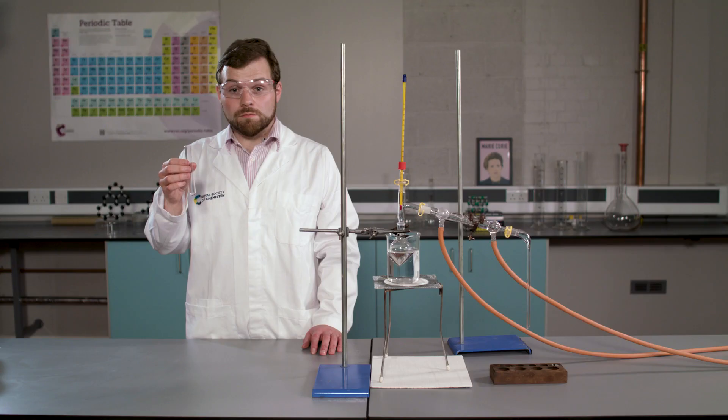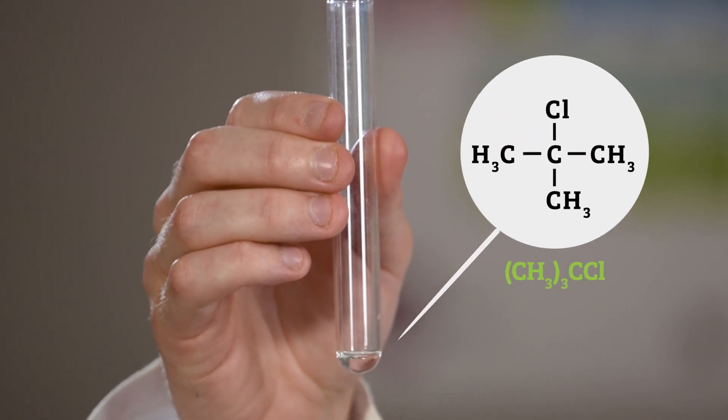So there we have it, my hopefully pure organic liquid sample. I hope you have enjoyed all the processes involved in making this organic liquid and have success in making your own.